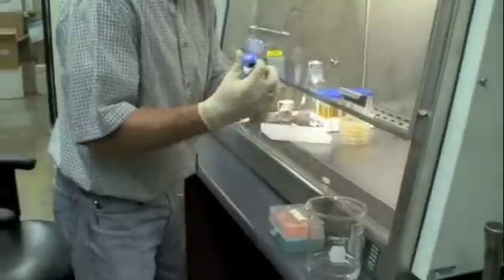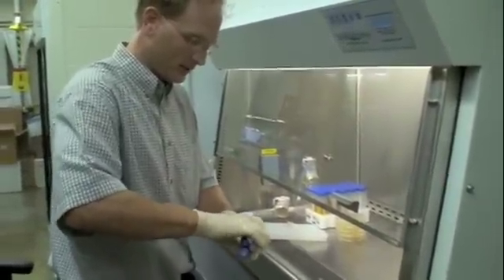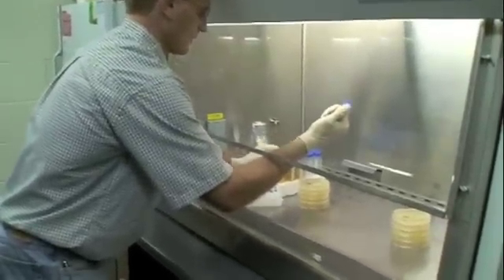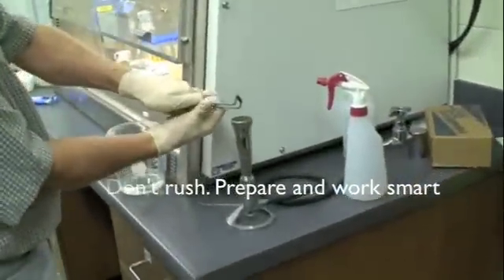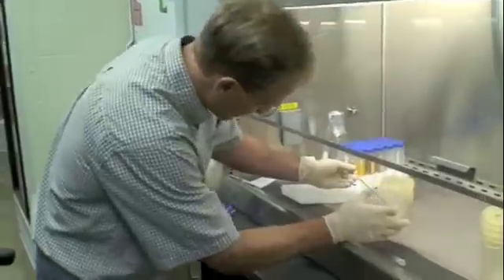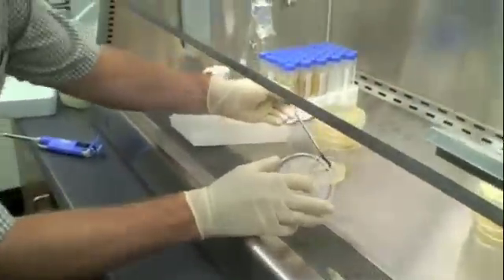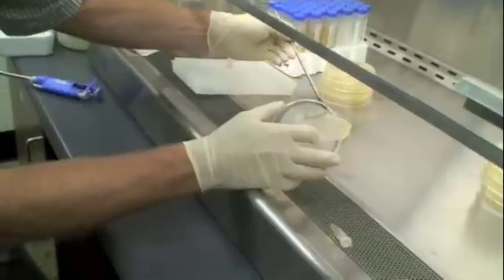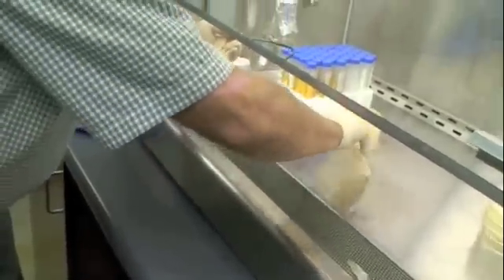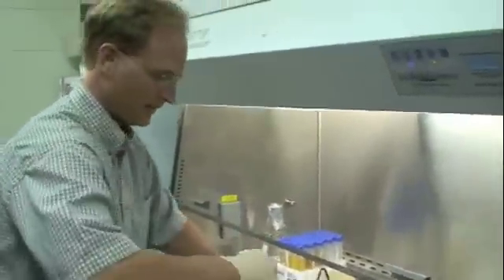I'm going to take 100 microliters from the cell suspensions. First I'll do the treatment — the insert library. I'll spread that on the plate here. Let me flame this to make sure it's sterile. Now we're going to spread the E. coli cells around. I don't want to push them too much to the corners — just spread them around so we have good, even coverage of the mix. That was the treatment, and now I'm going to do the control.